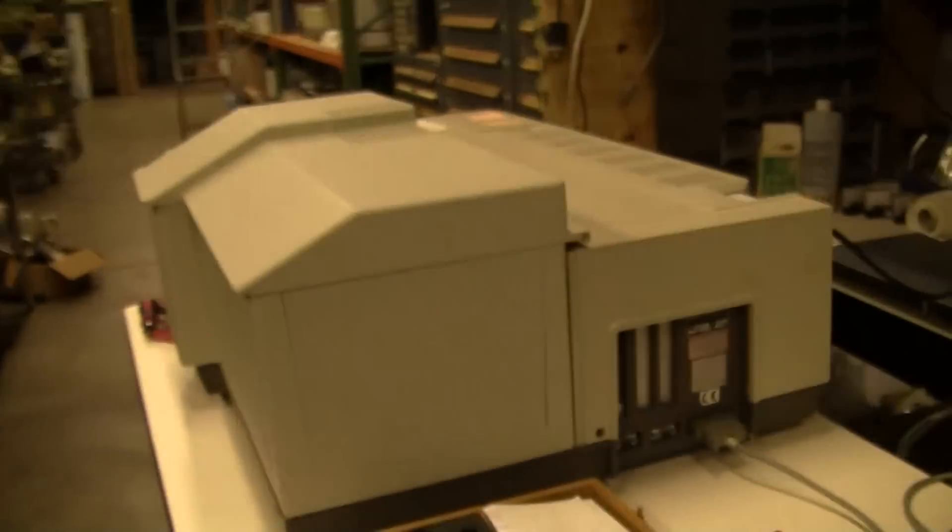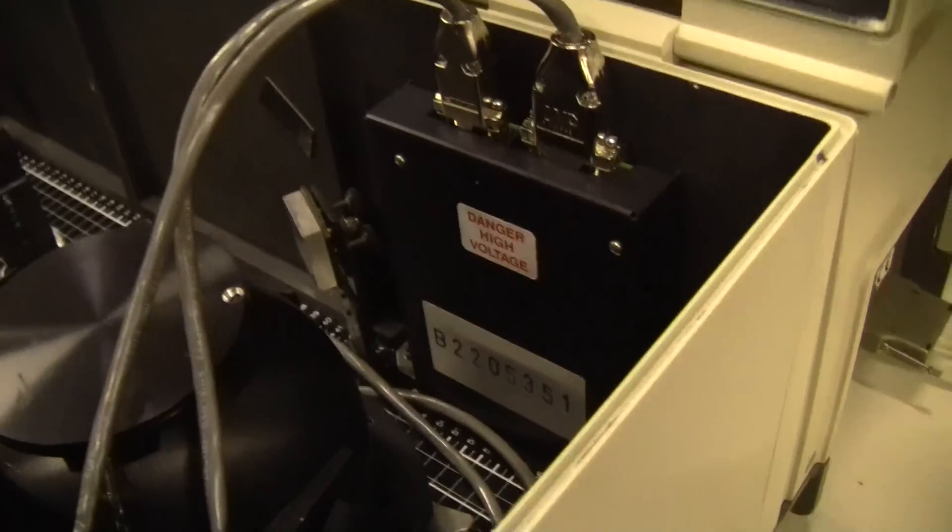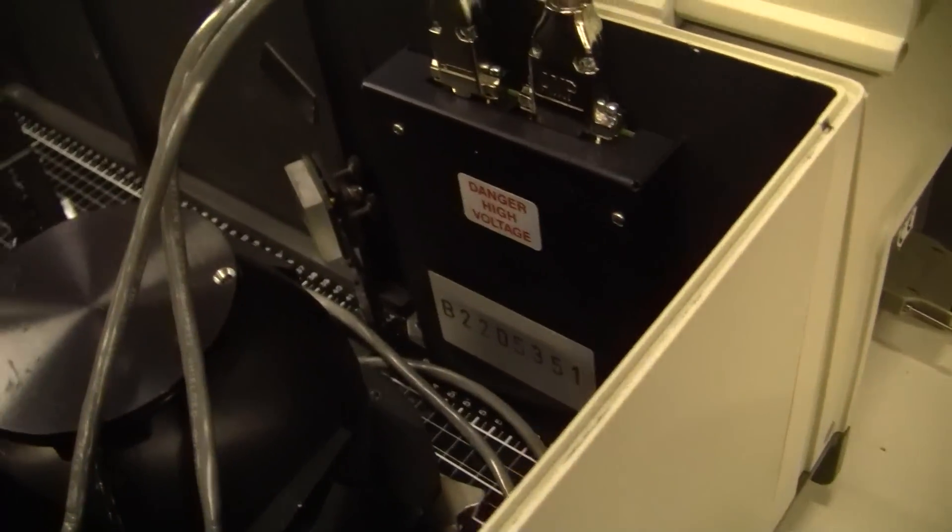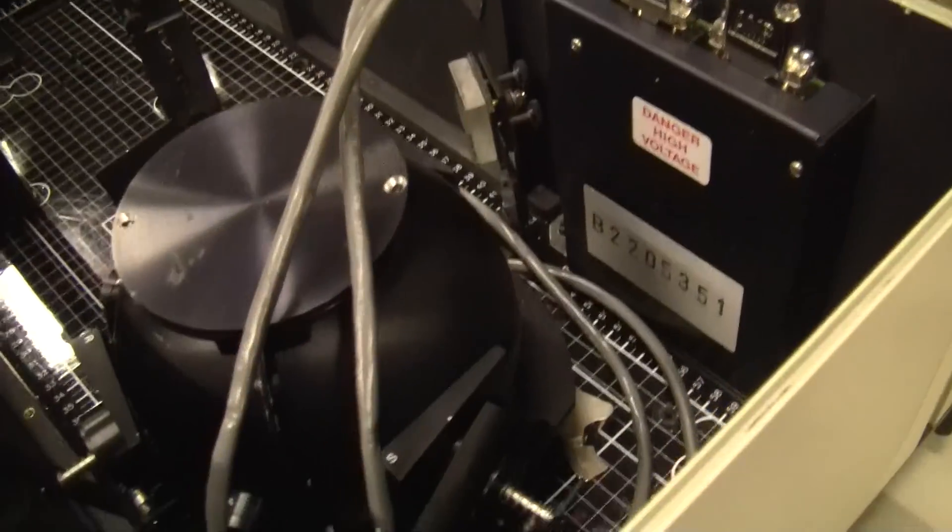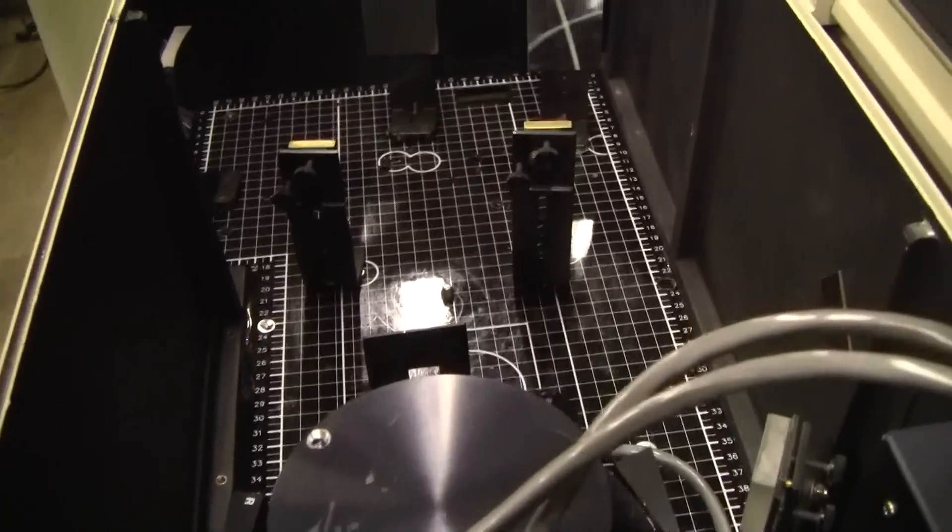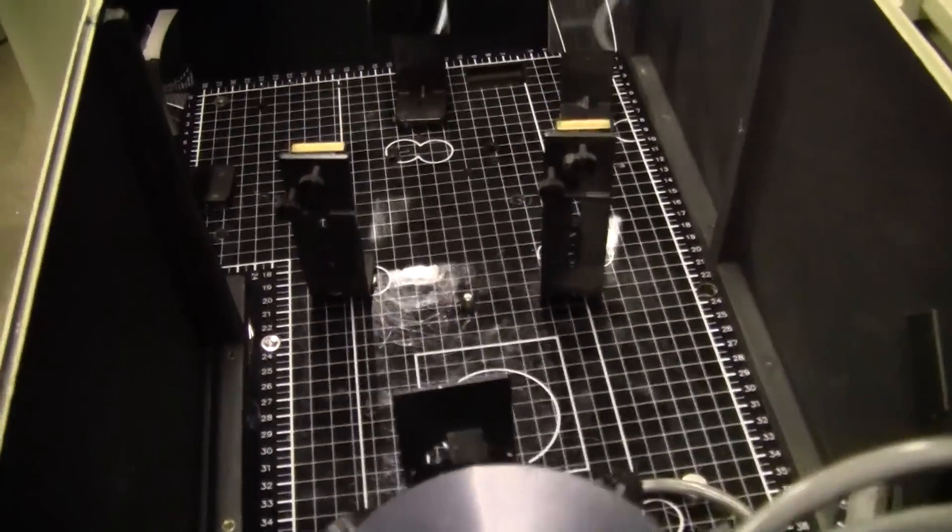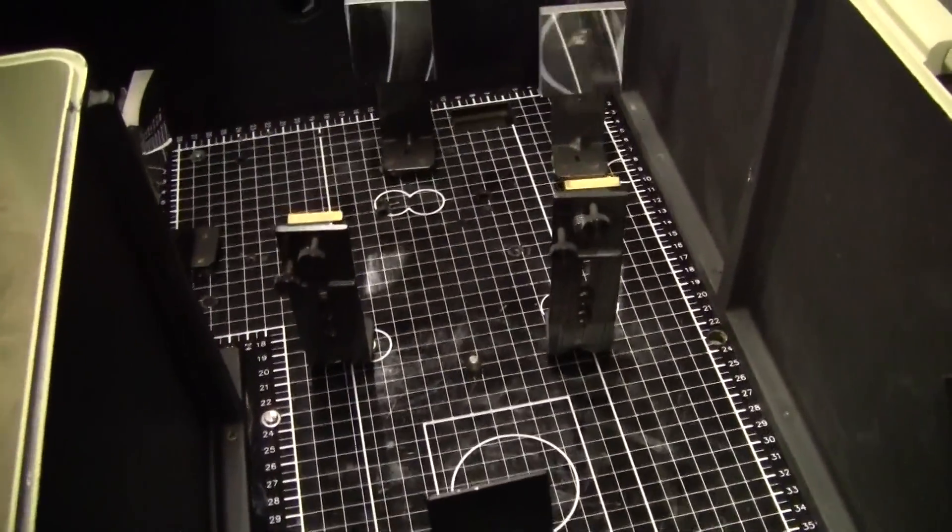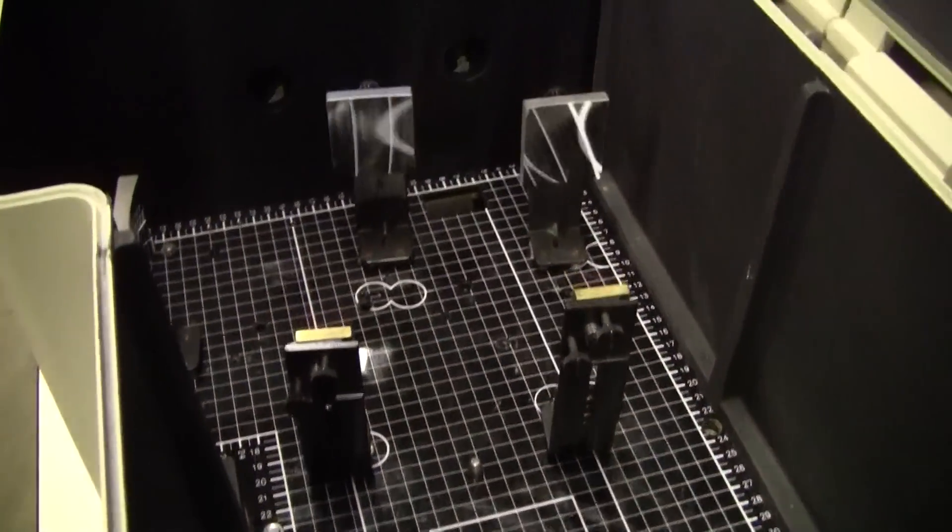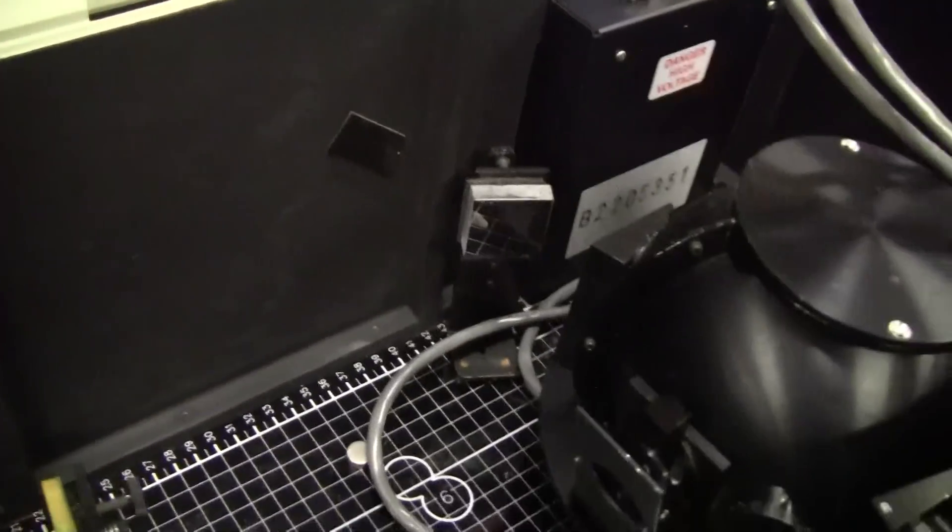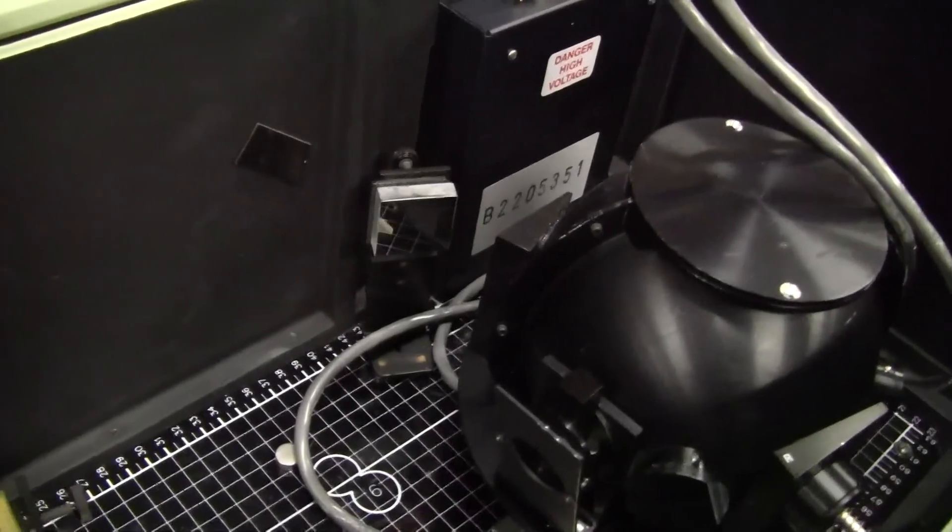Coming over to the bench. See the sphere set up. Mirrors. The reference mirror.